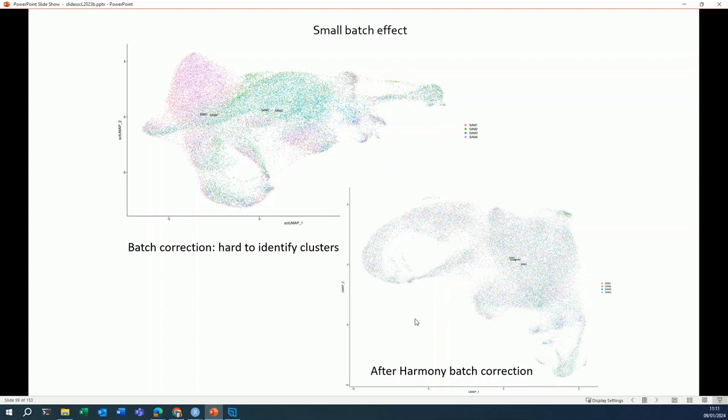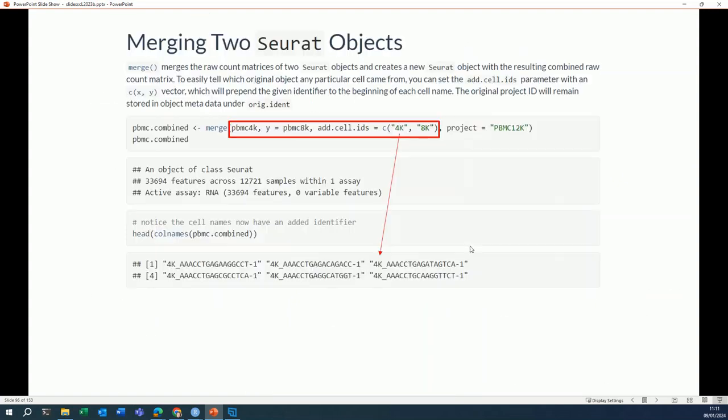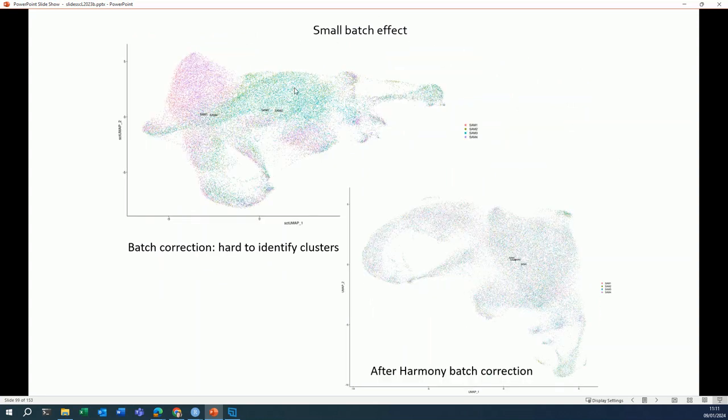And here you see the result after a Harmony batch correction. The Harmony batch correction is one of the least stringent ones. And you see that it removes the differences between the different batches, between the different samples. So they now all behave very similarly on the UMAP. And here you can see the danger of doing a batch correction if the batch effect that you see is biological. After the batch correction, everything behaves more or less similarly, so you will not see the differences anymore.